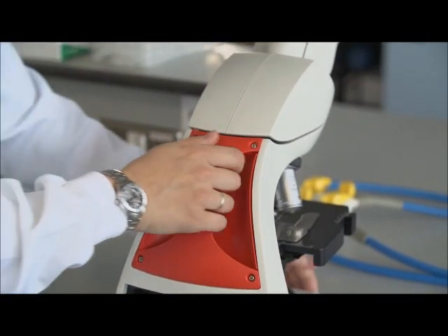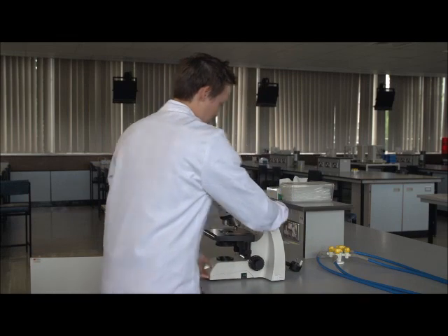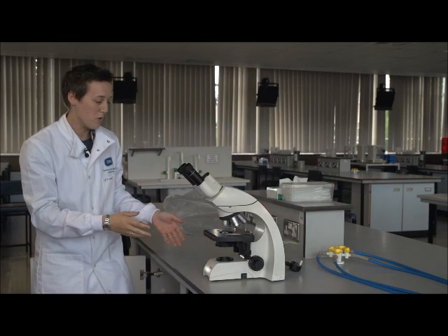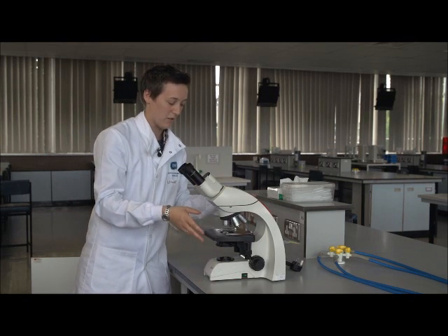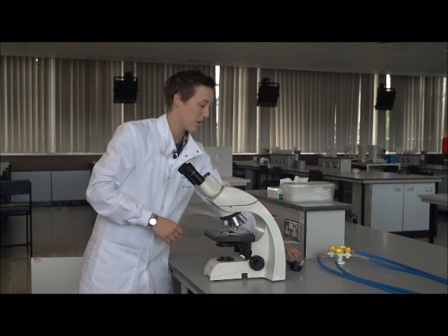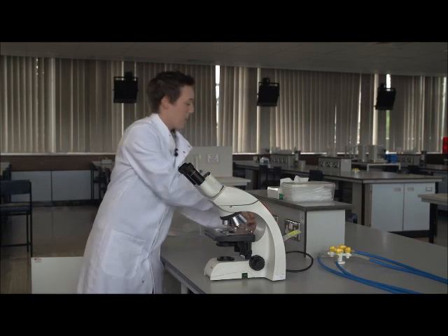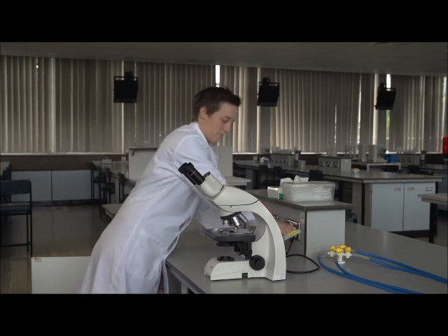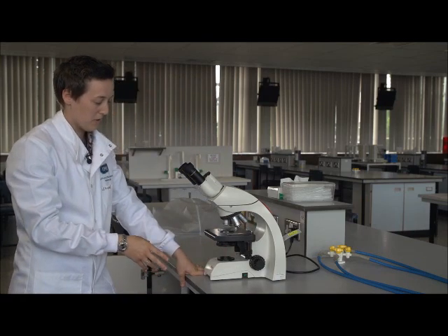And now we want to turn it so it's in position for use. Make sure that you lift it whenever you need to move it, rather than dragging it, because this can vibrate and damage the optics inside the microscope. And then untwist the cable at the back and plug that in. The microscope is now ready to use.